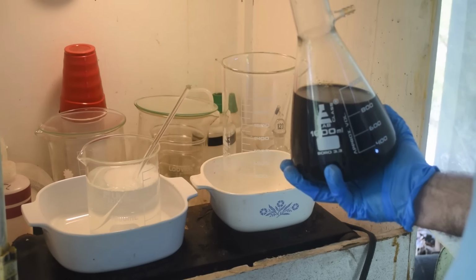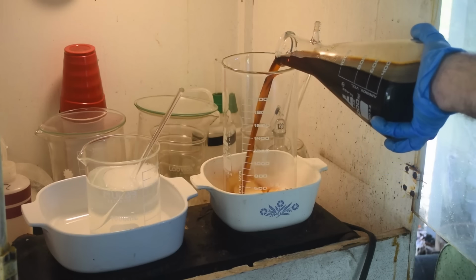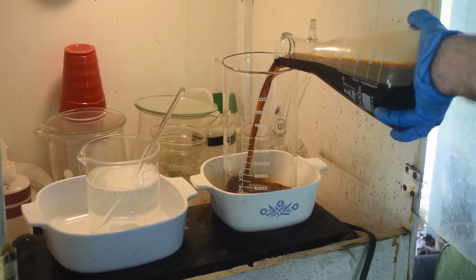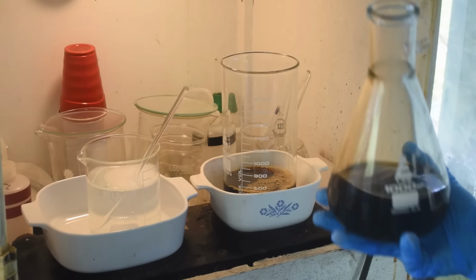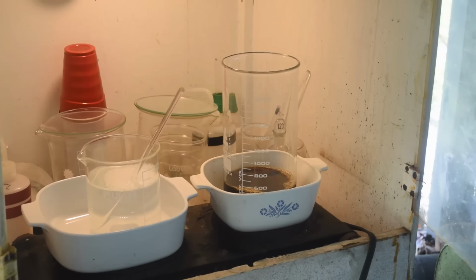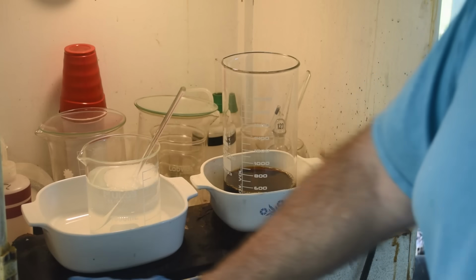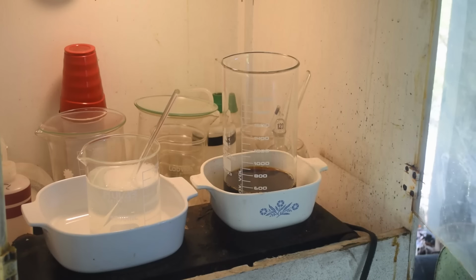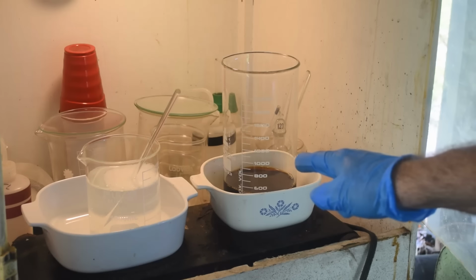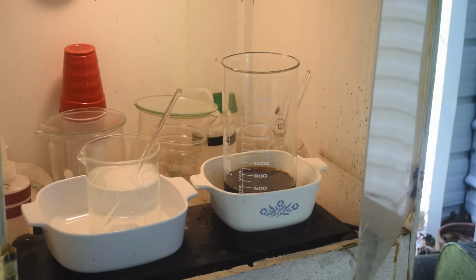I'm going to do this in a couple of stages. I'm going to put half this liquid in this tall 2-liter beaker. That's about half. All right. And I'm going to get both of these heating up. And we'll get them warmed up to just about boiling. And then we'll see if we can make some magic and turn this into palladium metal. So it's going to be a while for this liquid to heat up.